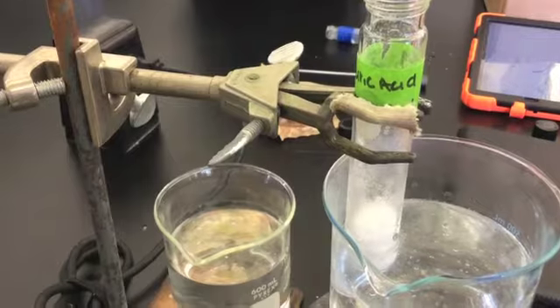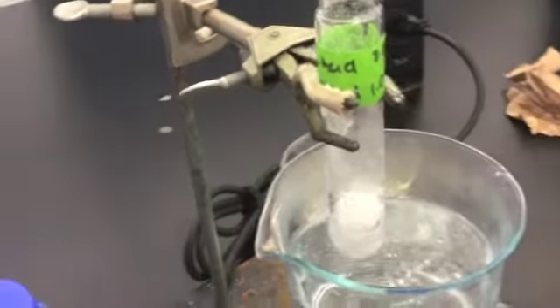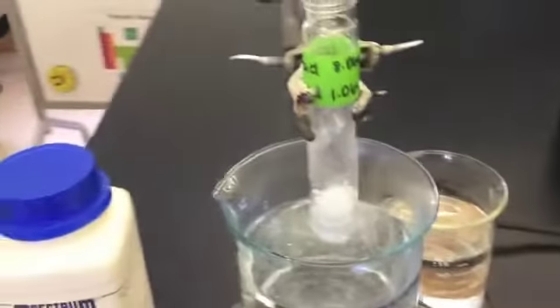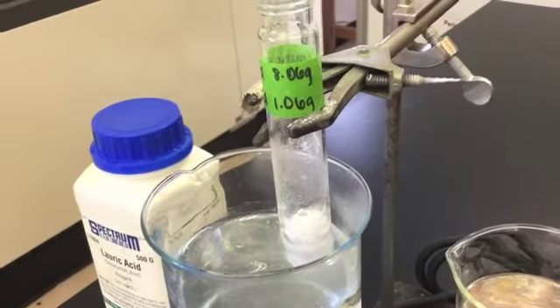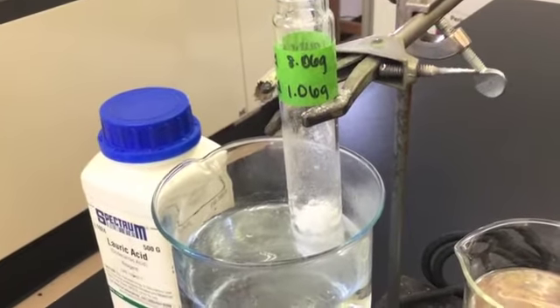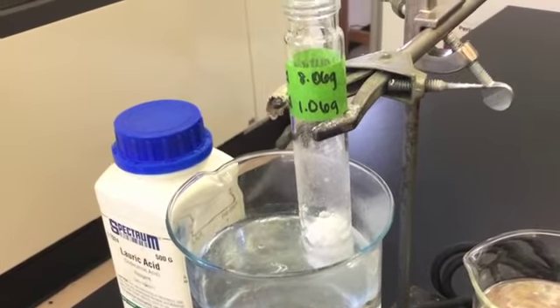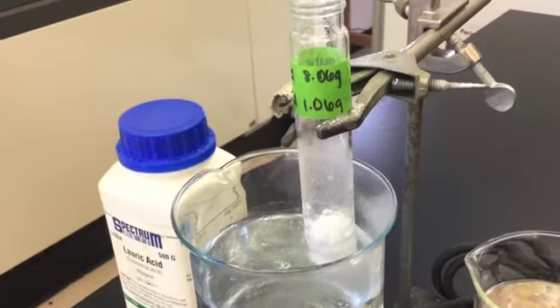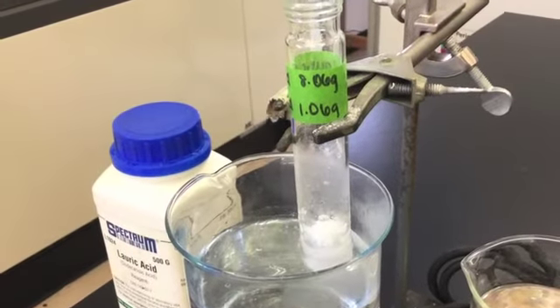We will now proceed to melt the lauric and benzoic acid mixture. This will have a green label. Be sure to record the mass of both the lauric acid and the benzoic acid. This mass for the lauric acid does not need to be the same mass that was on the original test tube. Pure substances, regardless of what their masses are, will have the same melting point. It is only the lauric acid in this test tube whose mass matters.